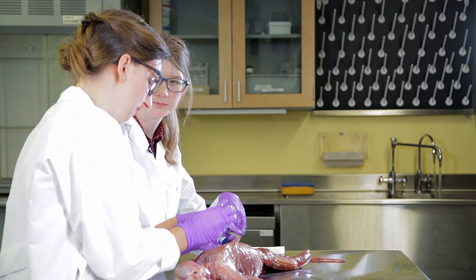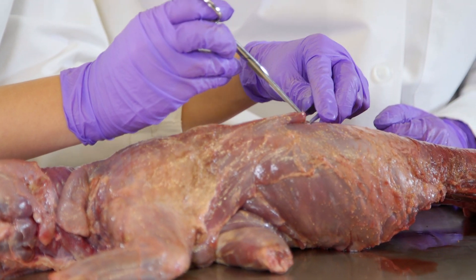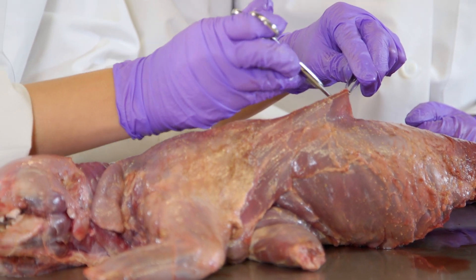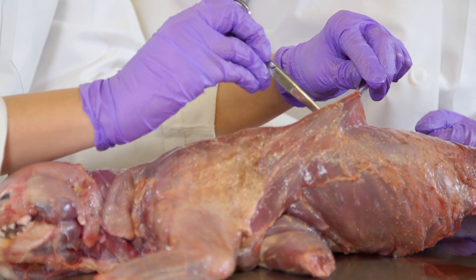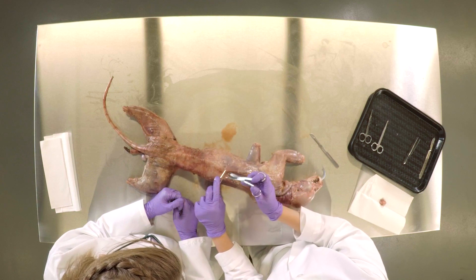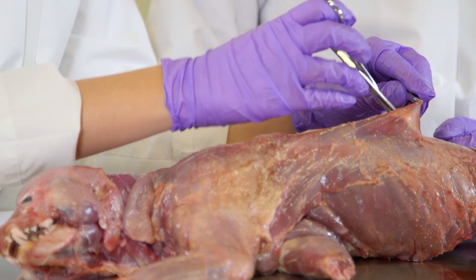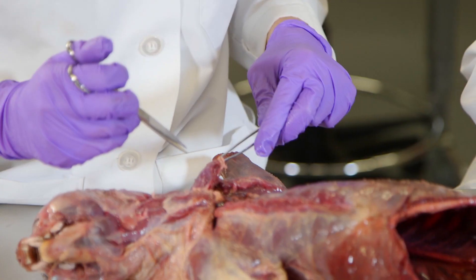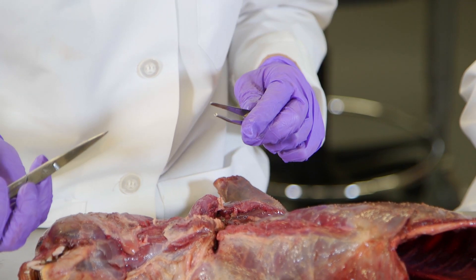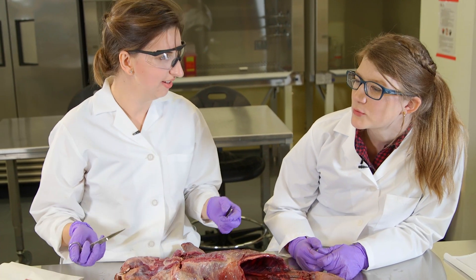So you're cutting the fascia between the muscles. Some muscles attach to bones to move bones, but some muscles actually attach to other muscles, and they do that by attaching to these thick sheets of connective tissue that we call fascia. That helps them to move, and it's kind of cool when you think about all the different things that mammals do with their arms, like bats flying or whales swimming.